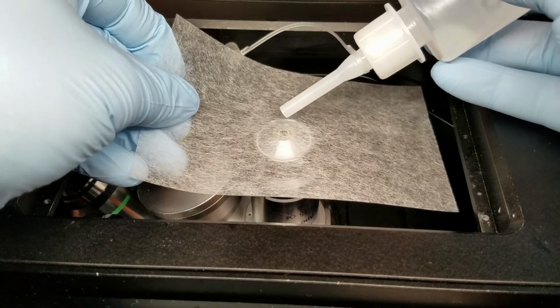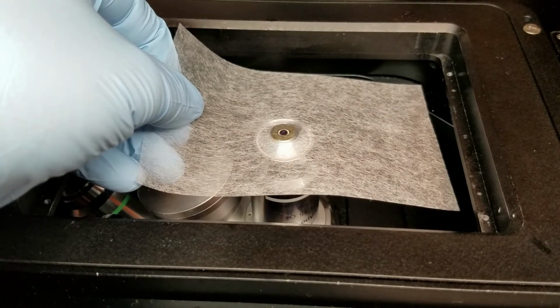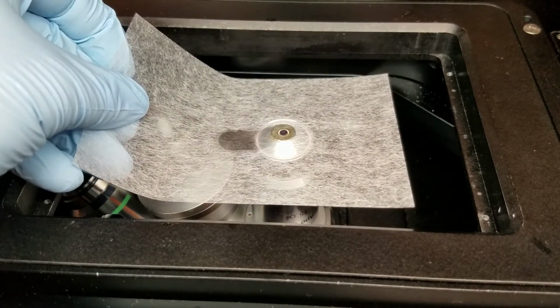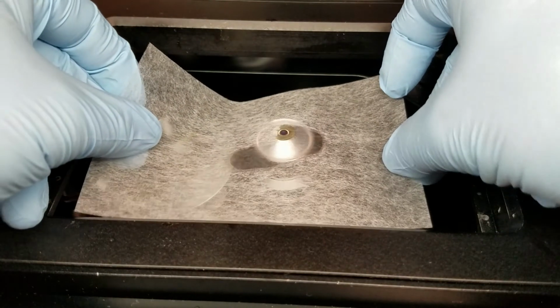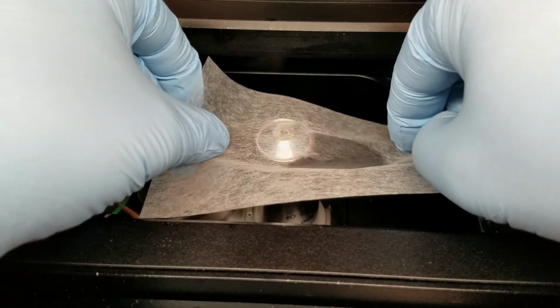We're going to put one drop on, as you can see. Let it sit there for a moment. I usually give it like a 3 count or a 5 count, and then just drag in one direction. All we're doing is removing, if we use the lens cleaner, any sort of soap or surfactant that was on there, and then we're just getting rid of as much of any of the remnants as we can to make a nice clean objective for the next person.